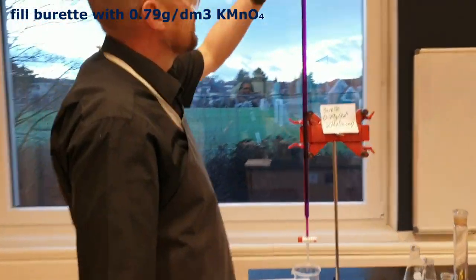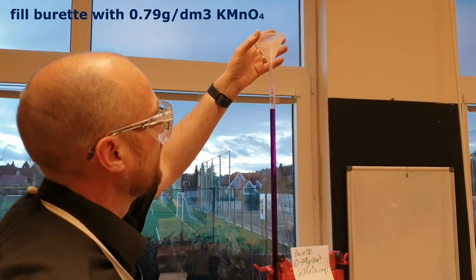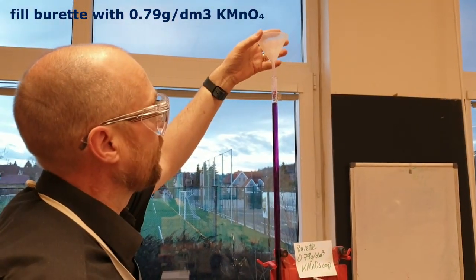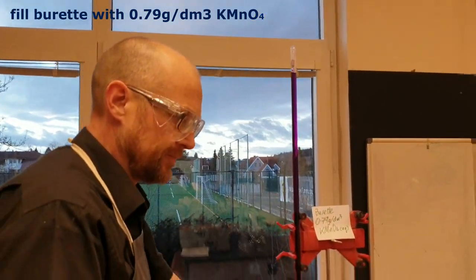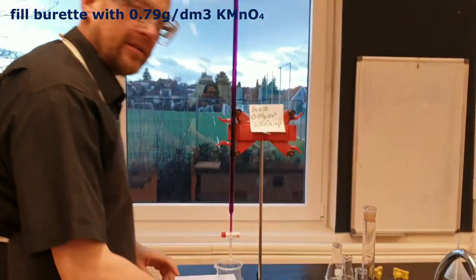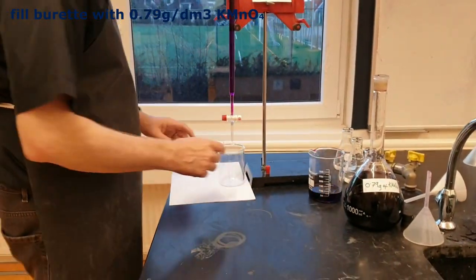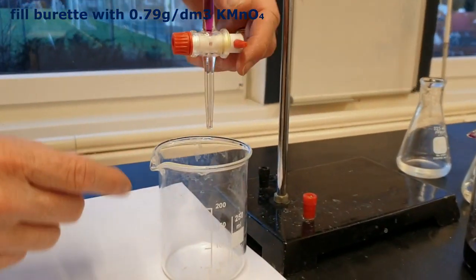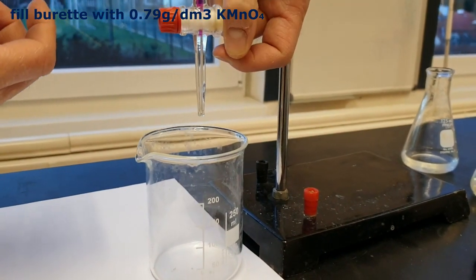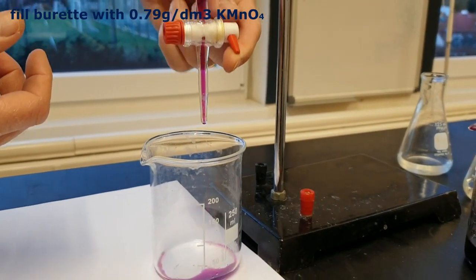Take the funnel out because it's dripping. And this equipment is supposed to be accurate to one or two drops. So if the funnel is dripping, that's going to cause trouble. Are you ready to start? You are not ready to start because there's an air gap here. You've got to clear that air gap first. Fantastic.